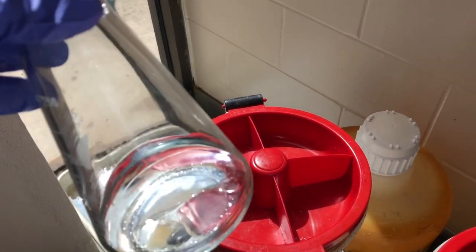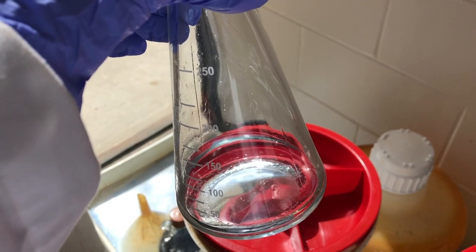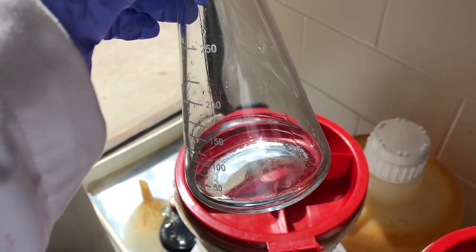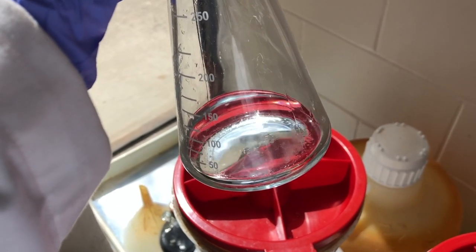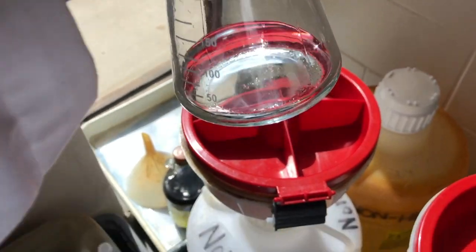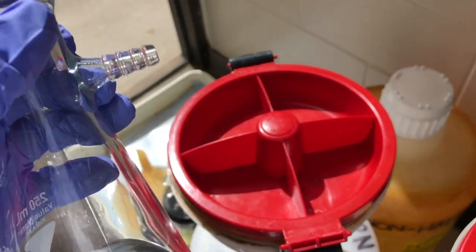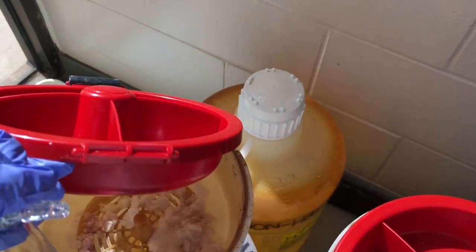Waste disposal is quite important in where we place it. So what we're going to do is we're going to place our filtrate in the non-halogenated aqueous waste.